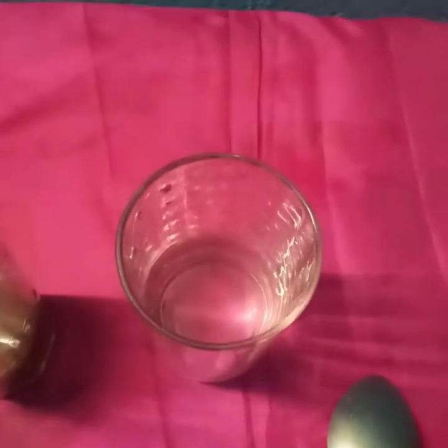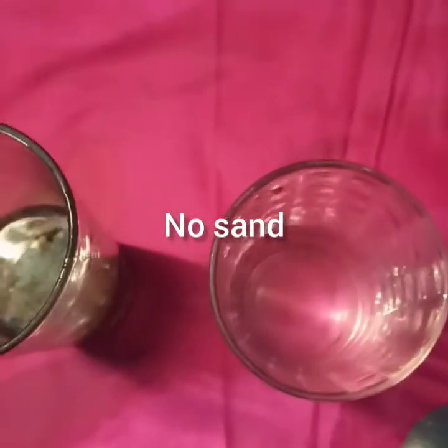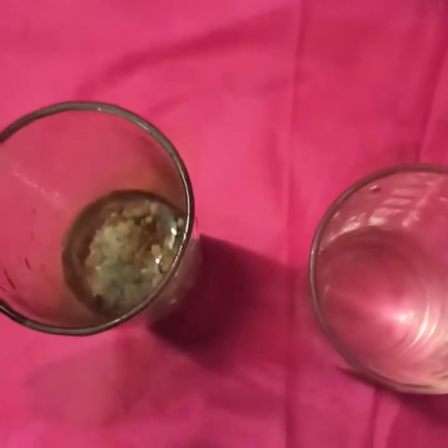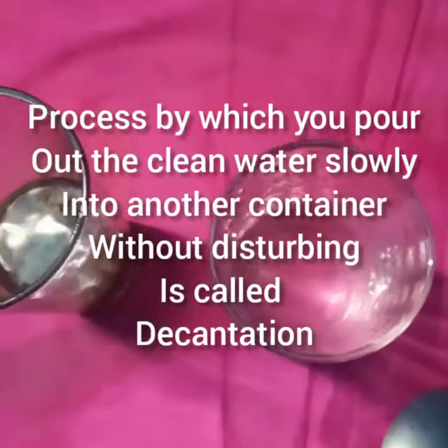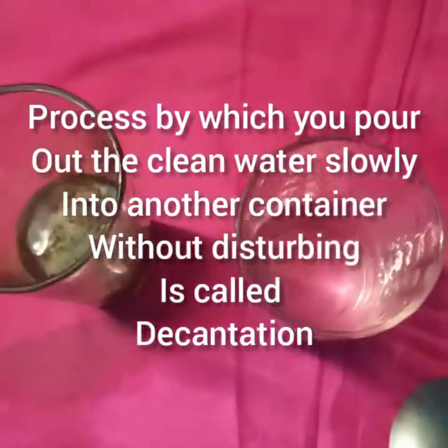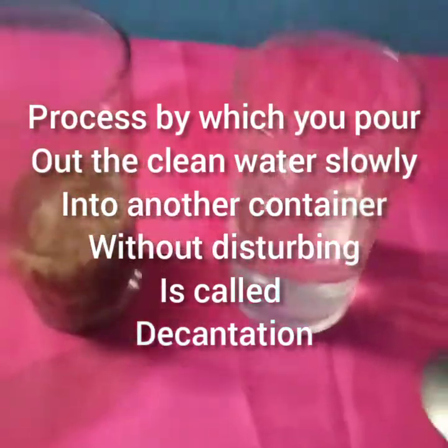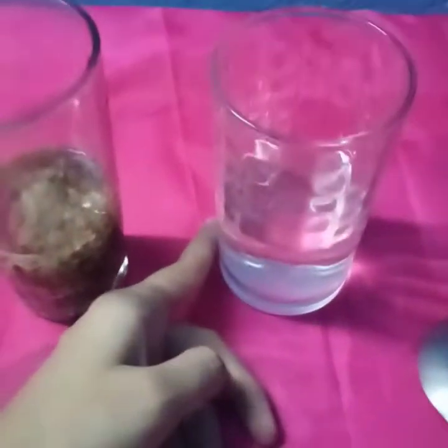We see that the water poured into this beaker is much clearer. You can see there is no sand in it. It is much clearer and does not contain any sand. The process where you pour out this clear water slowly into another beaker, as we have poured water from this beaker to this beaker slowly, is called decantation.